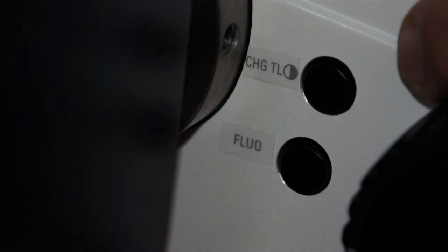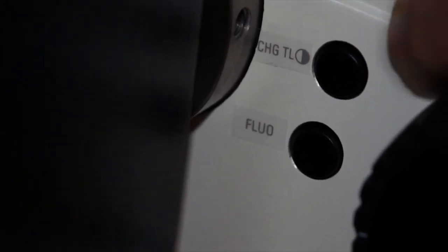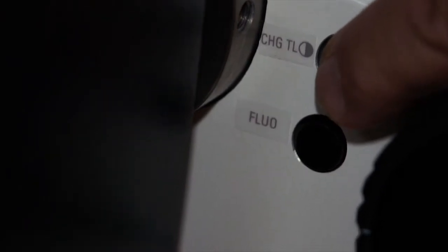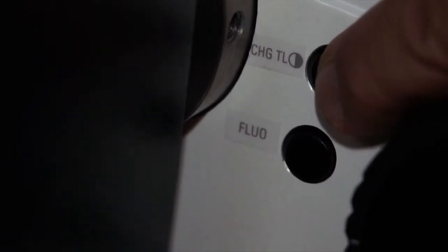The first button allows you to toggle between the different transmitted light illumination methods that you're using — for example, bright field, DIC, or polarized light. The second button down allows you to go from transmitted light to fluorescence, so you can toggle between your transmitted light method and the fluorescent method that you've selected.